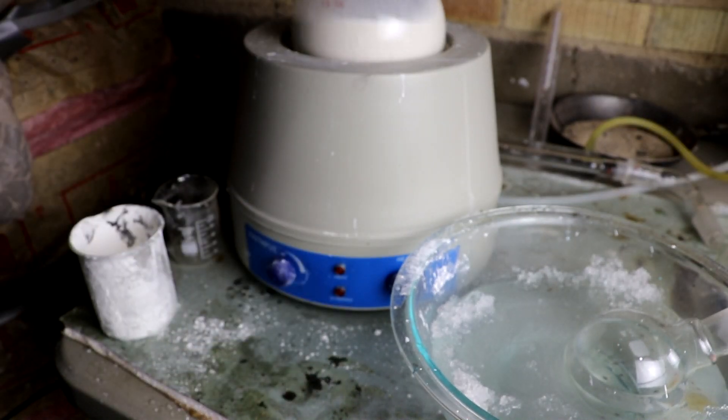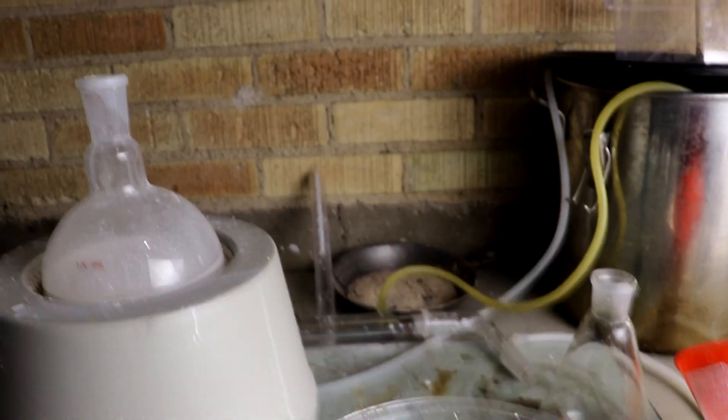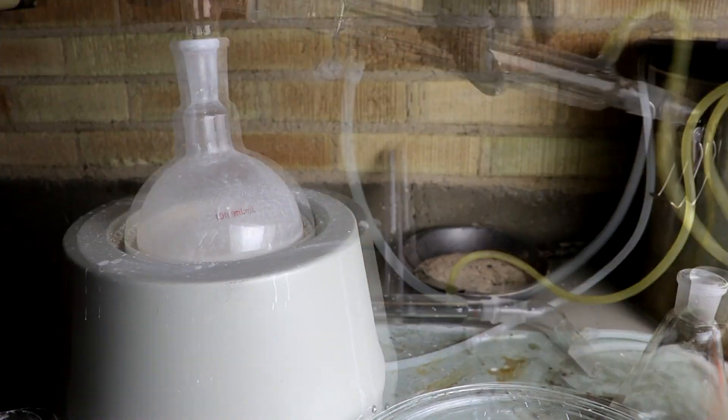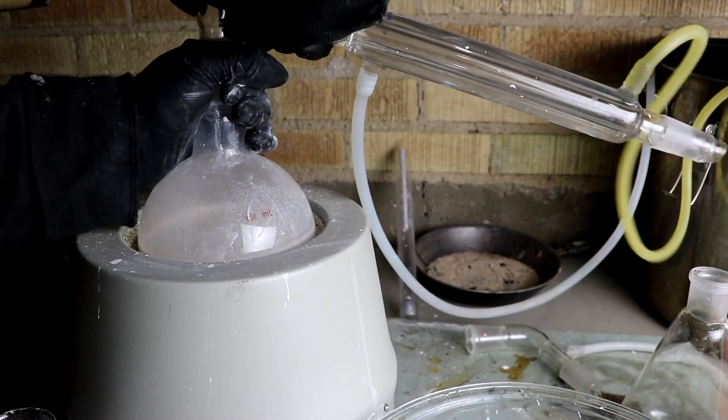Okay, I'm going to set this into my heating mantle. Turn on the stirring. Now I'll just hook up my glassware.